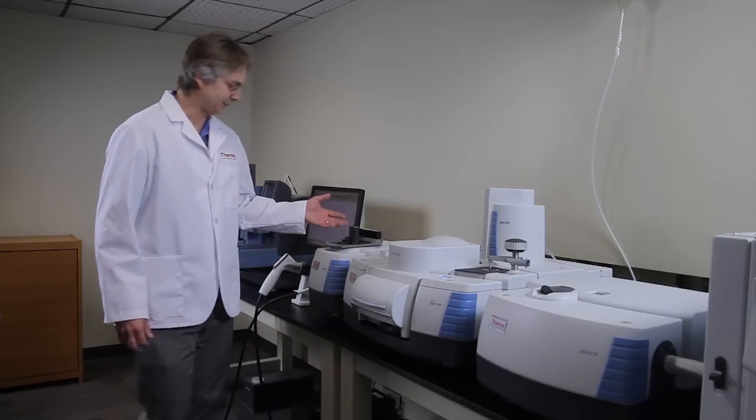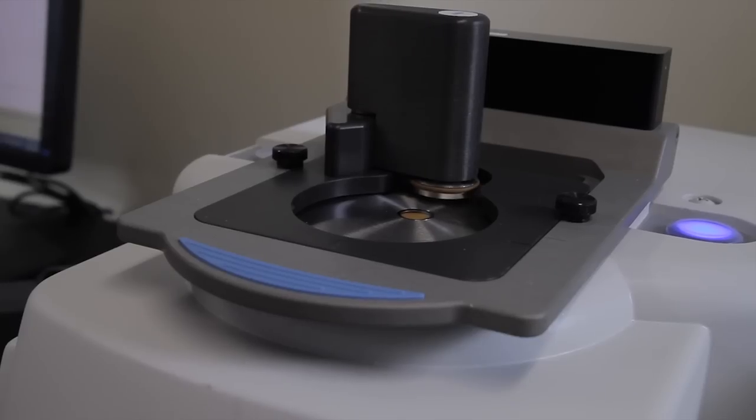Today, we're going to look specifically at collecting spectra using the near-infrared modules. So let me go ahead and get started.